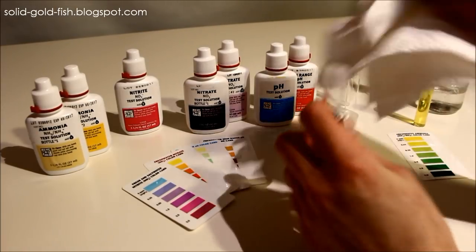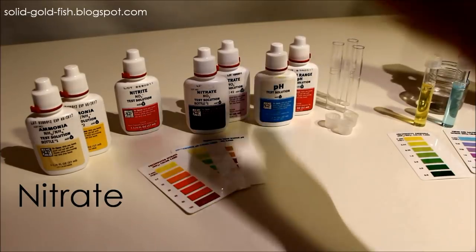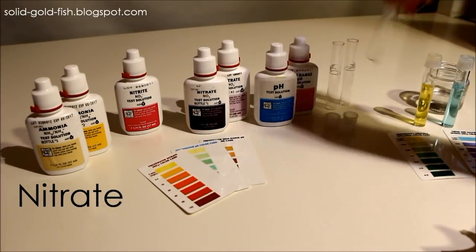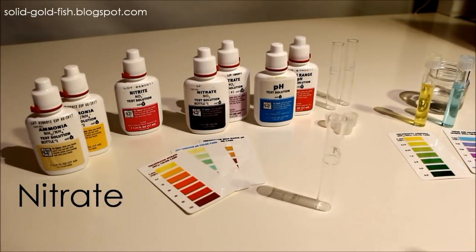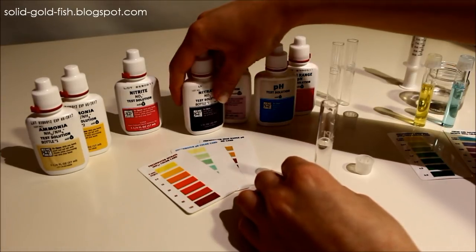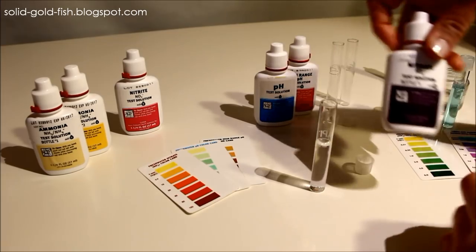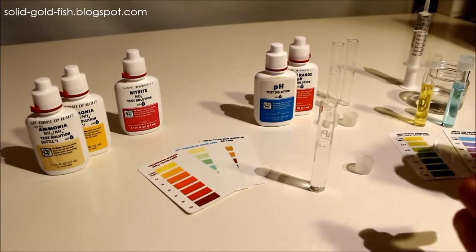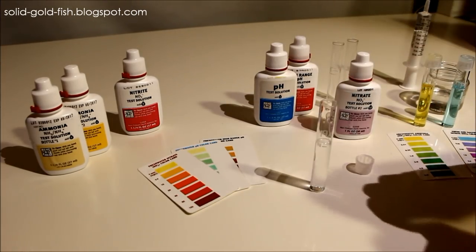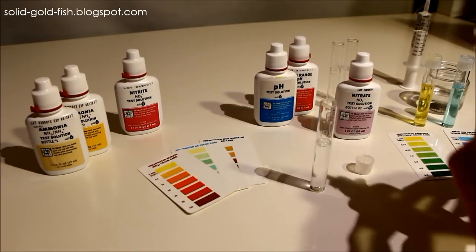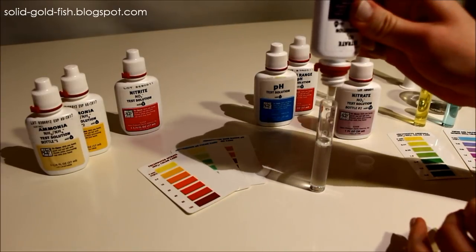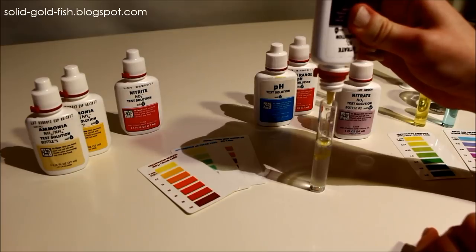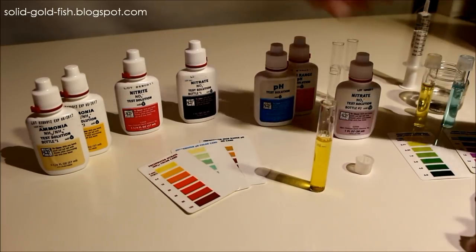Next is the nitrate test. This one is a little bit more involved than the other ones. It also has two test solution bottles and you add the first one first and the second one second, and you add ten drops of each.